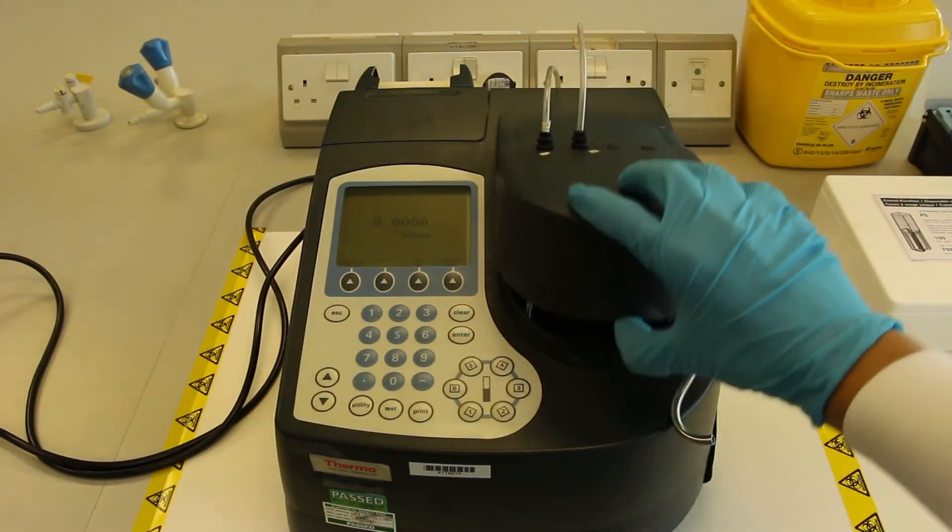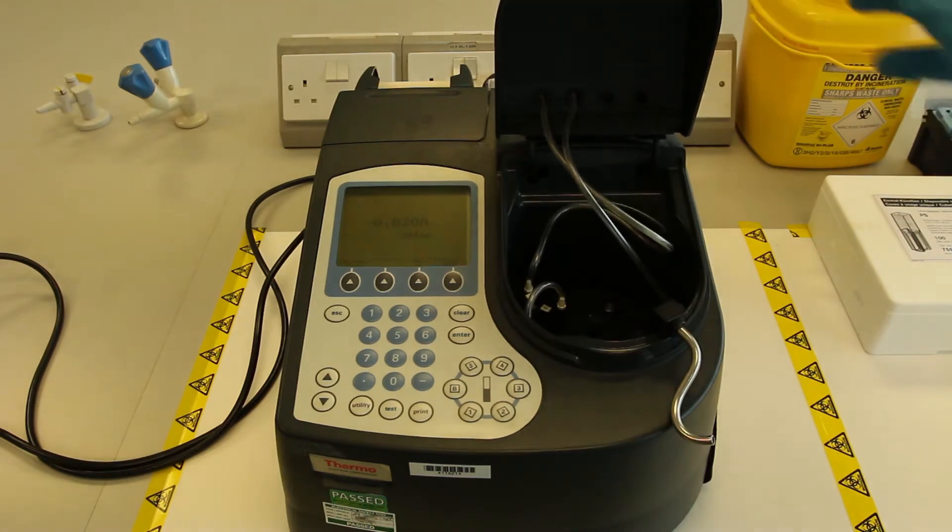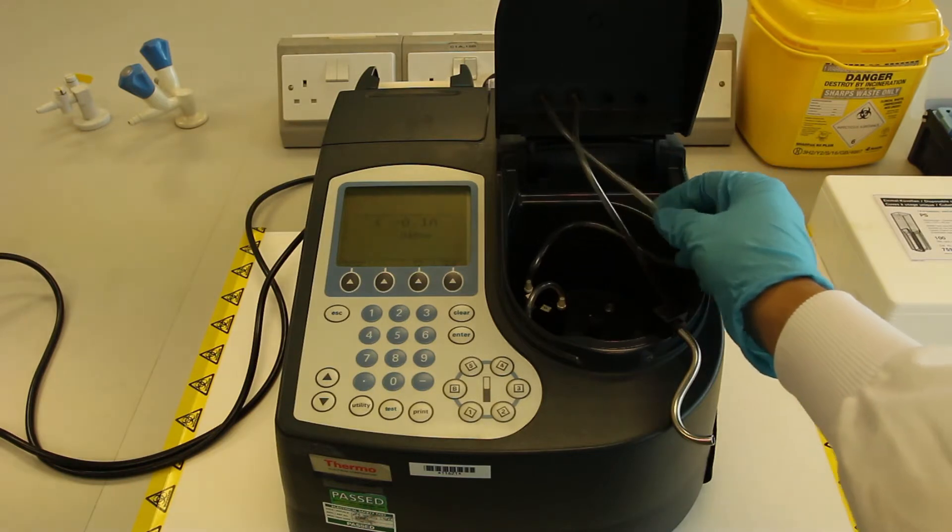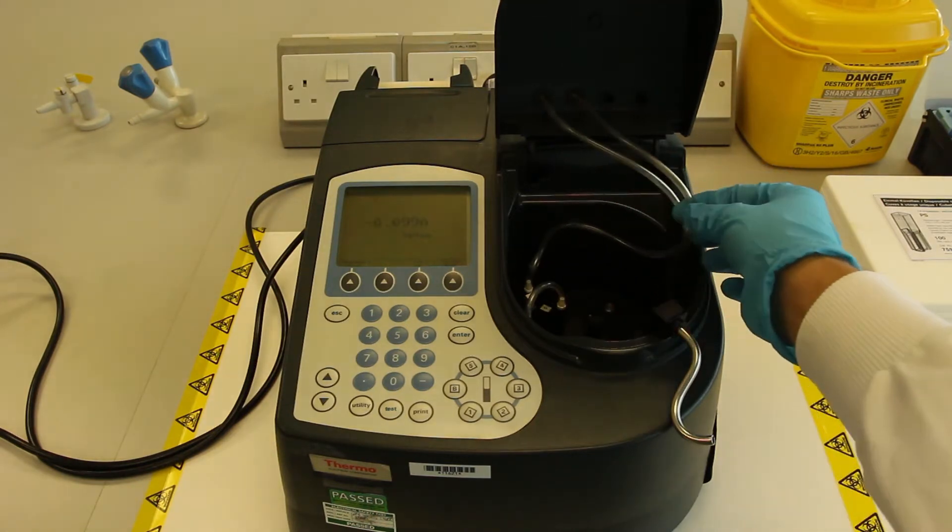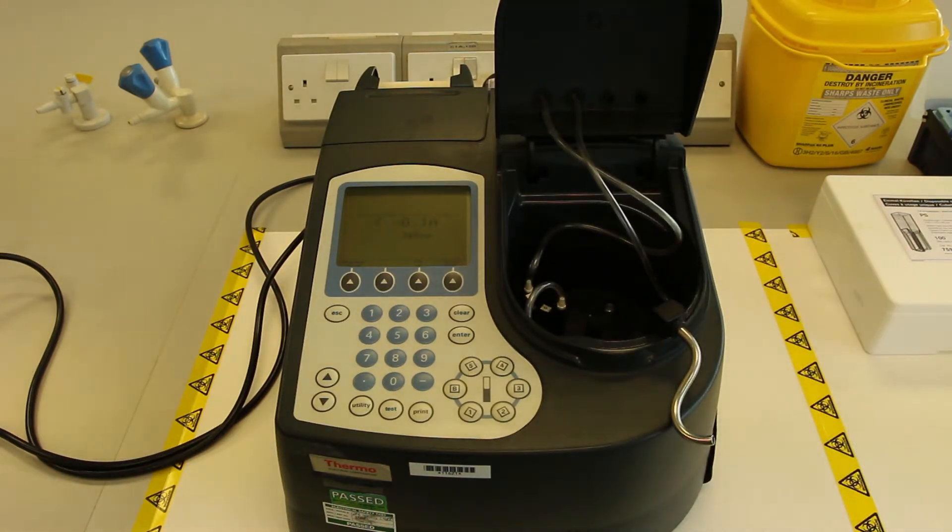The next thing that you should do is inspect the machine. Open up the sample port and inspect the cuvette holder. It is good practice to make sure everything is in functioning order and clean.